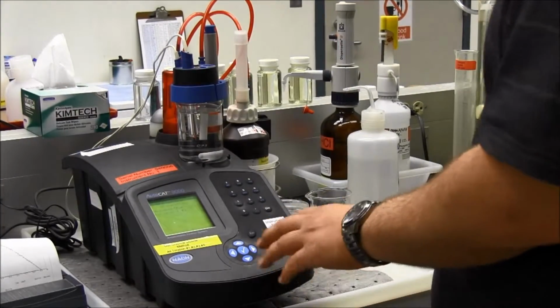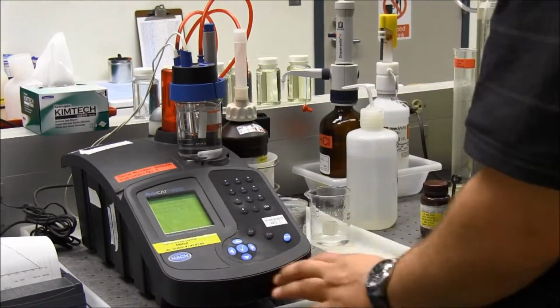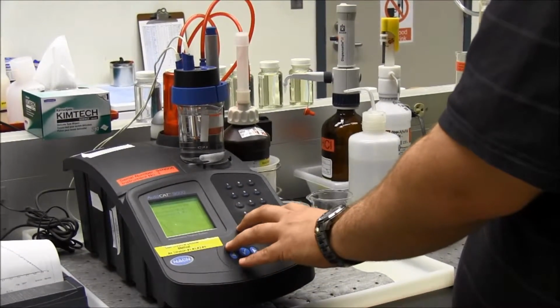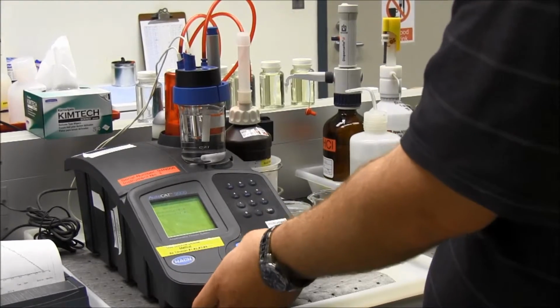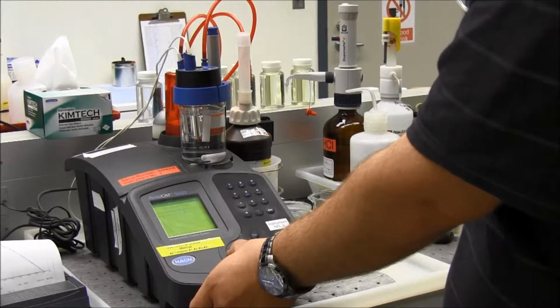Okay, so now this fourth titration is done also, and I also have a nice sloped line with a clear endpoint. I'm going to adjust the cursors on this one also, so I'll hit delete. This one I'm going to move the first cursor first. And I'm going to go all the way to the top.